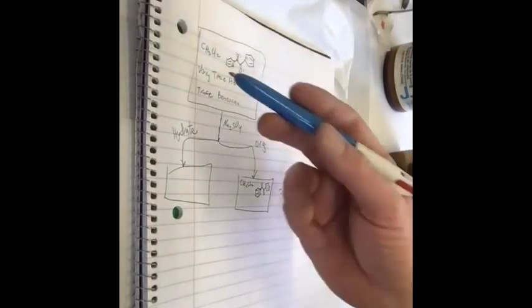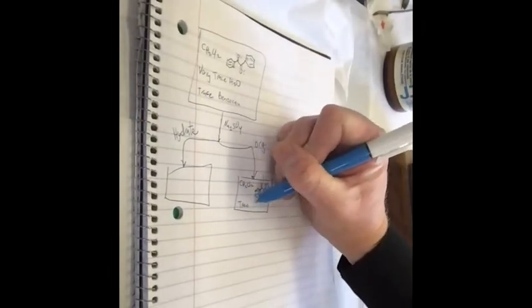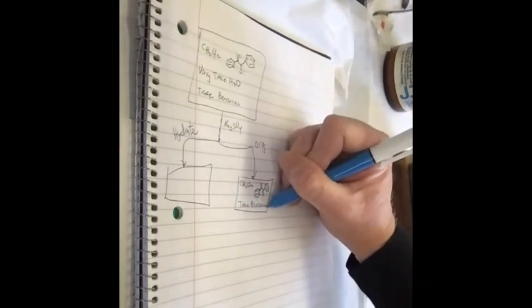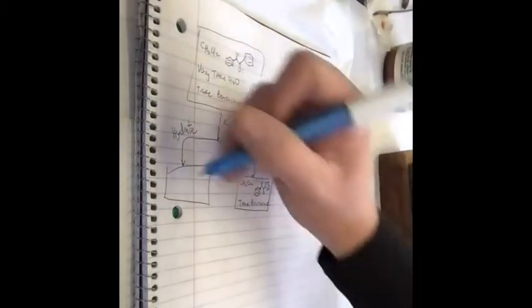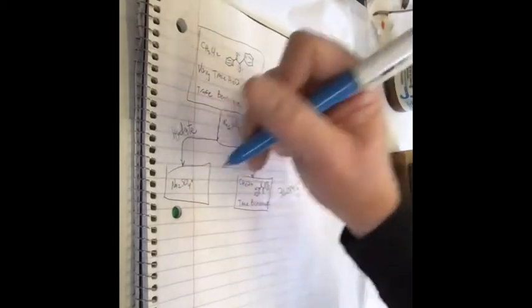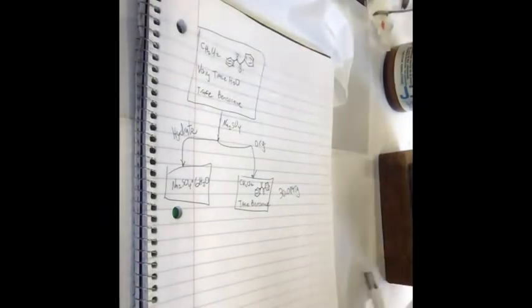I'm sure there's a tad of water, but let's say it's so very, very, very trace, we'll ignore it. And there's probably still some trace benzocaine. And then over here, the hydrate, you'll have sodium sulfate. And I think maybe the most common is the hexahydrate. So it can hold on to 6 water molecules per sodium sulfate unit.